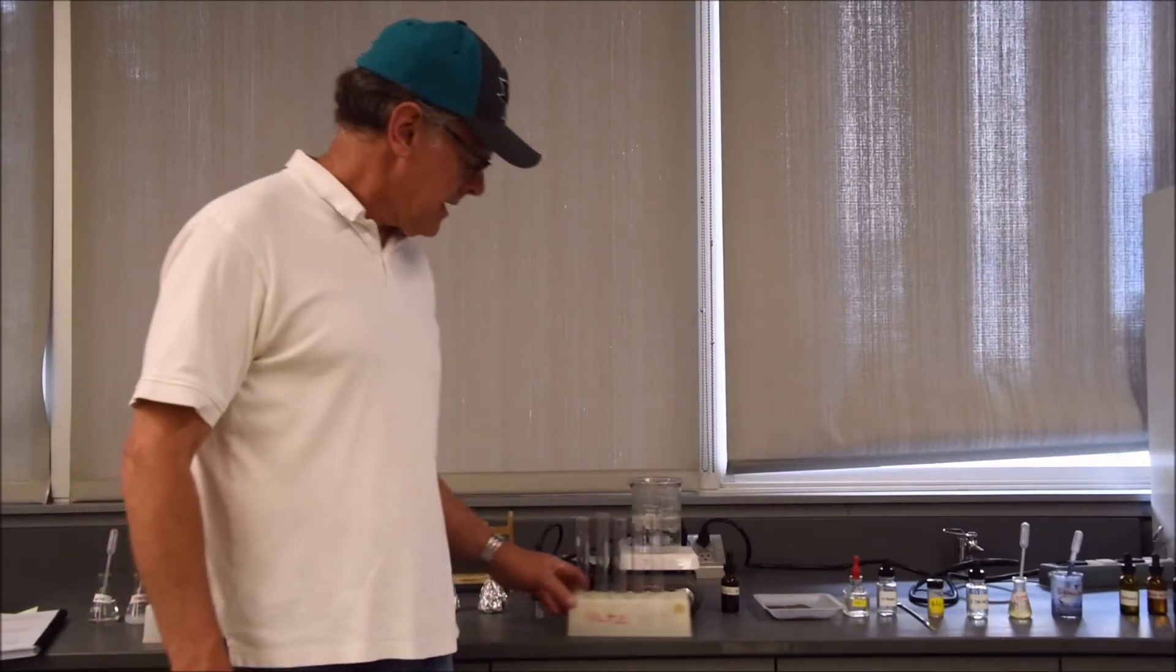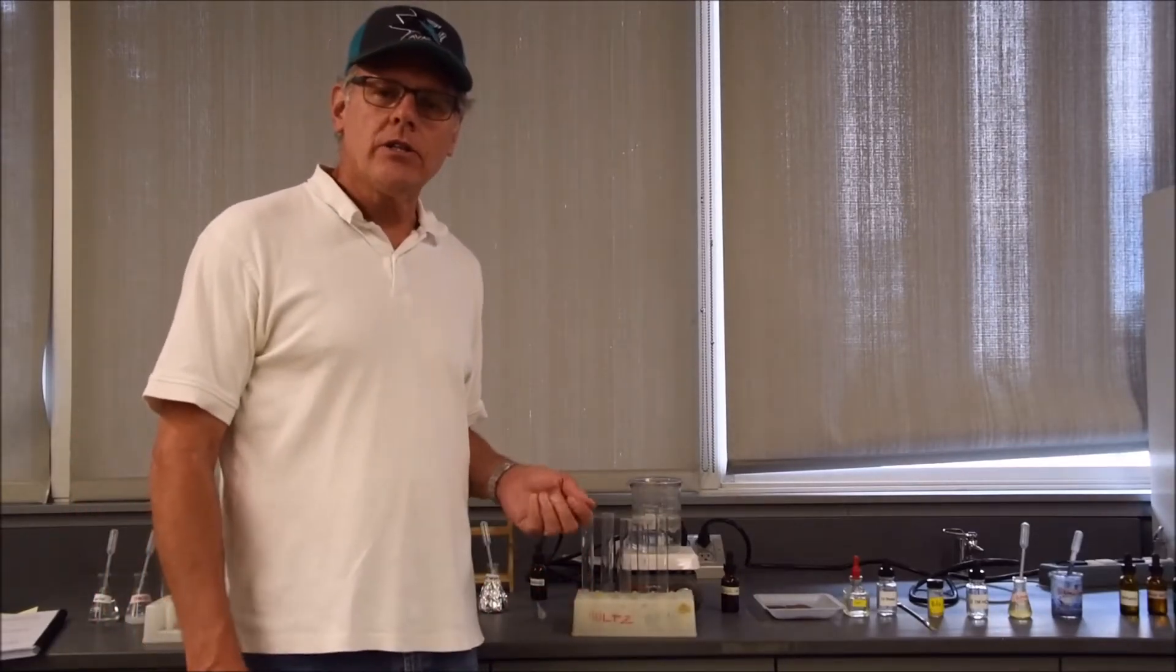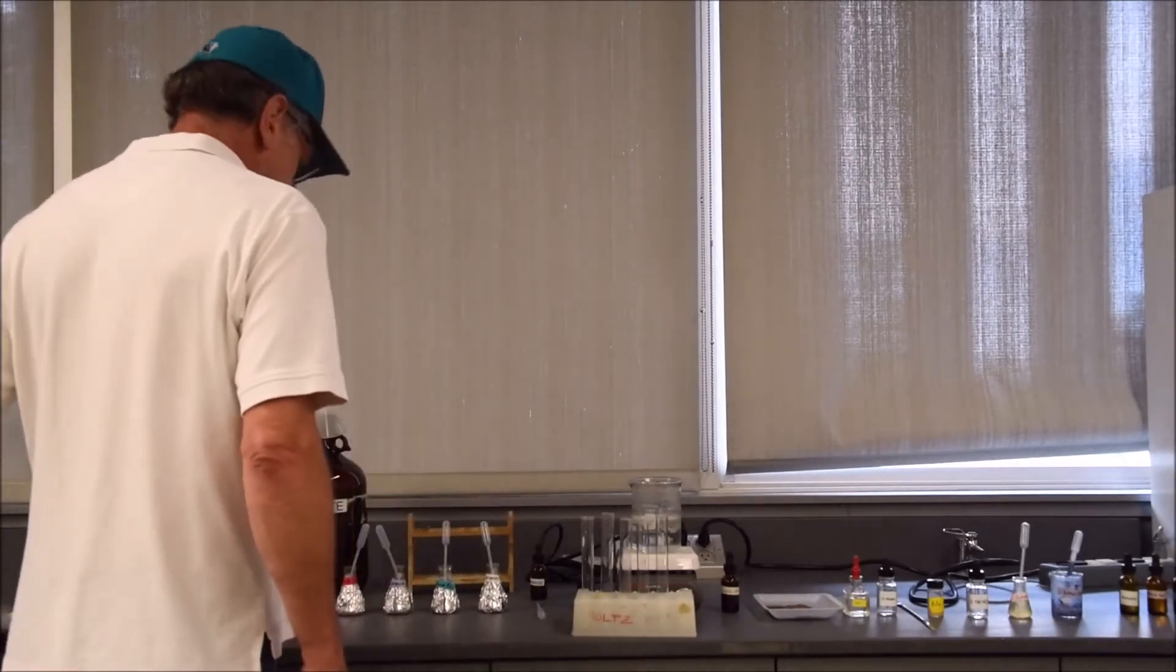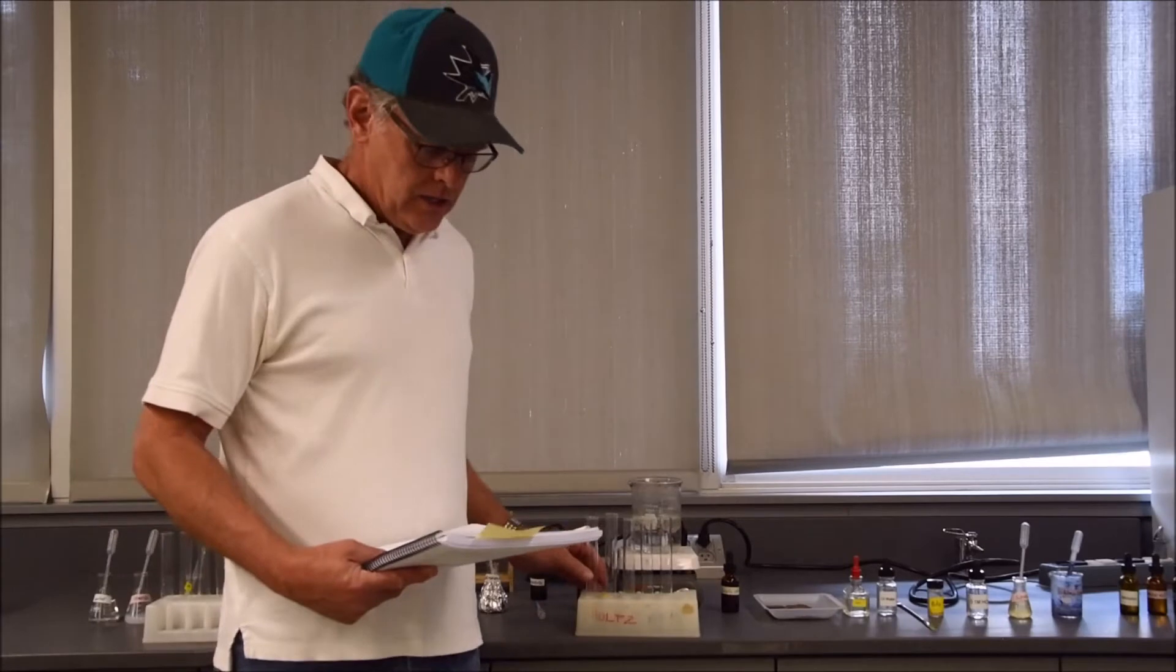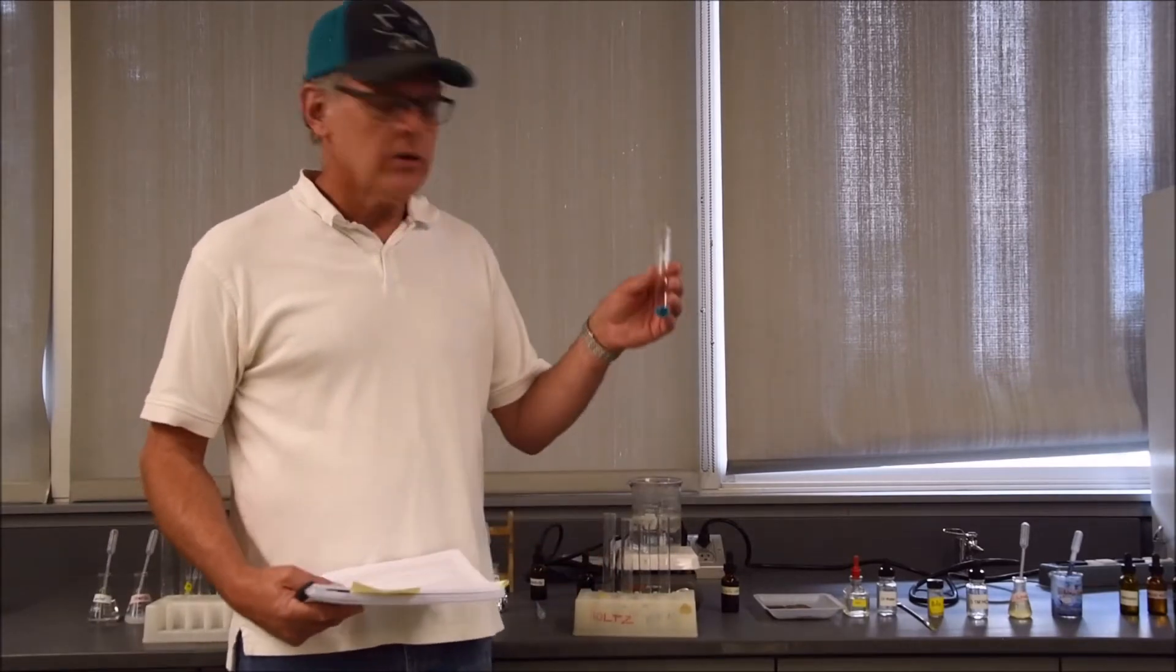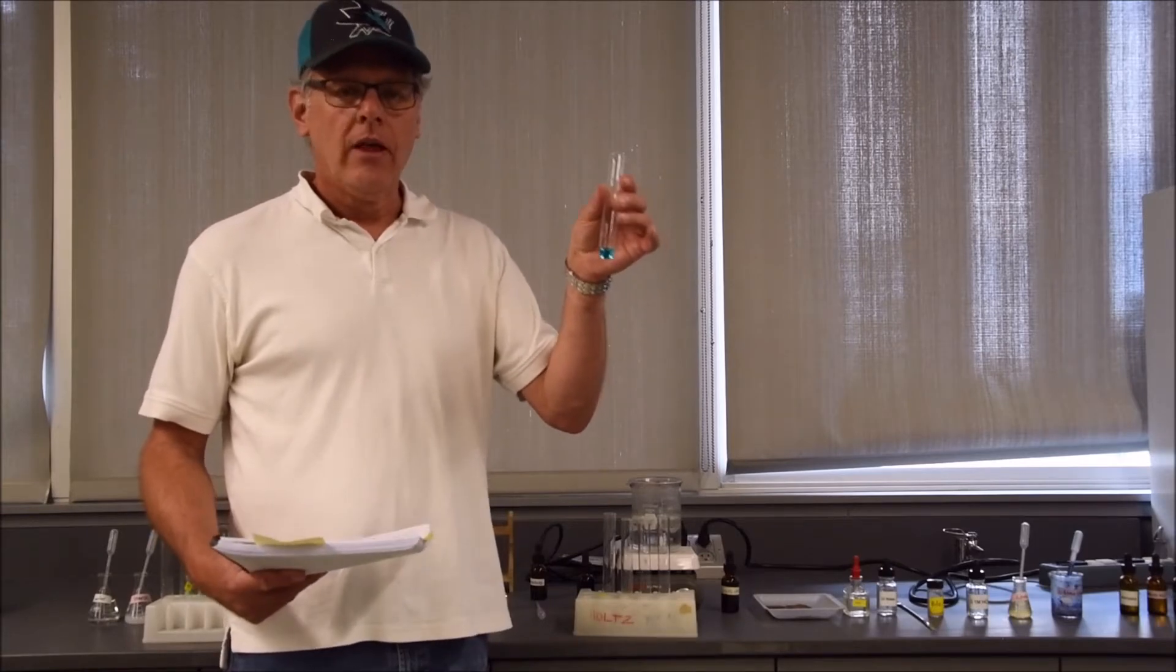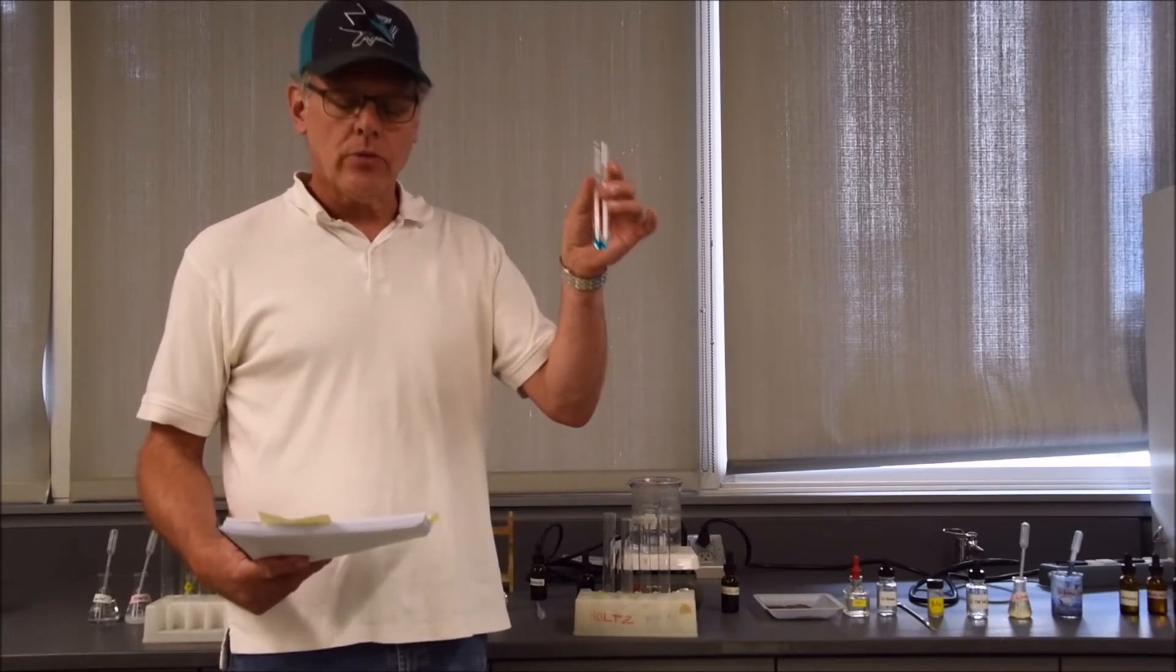This is the Benedict's test. Benedict's is a reagent that reacts with monosaccharides. I have in tube number one water and Benedict's reagent, and as you can see, the Benedict's reagent has some blue color to it. You want to write down this as your original color.